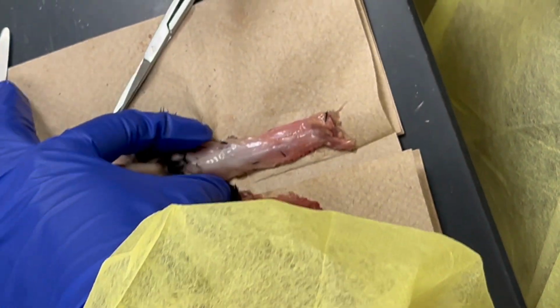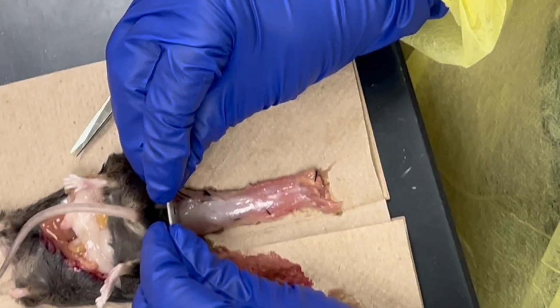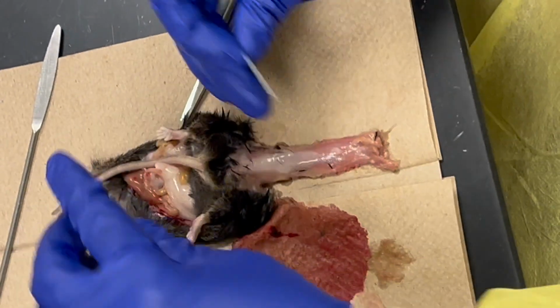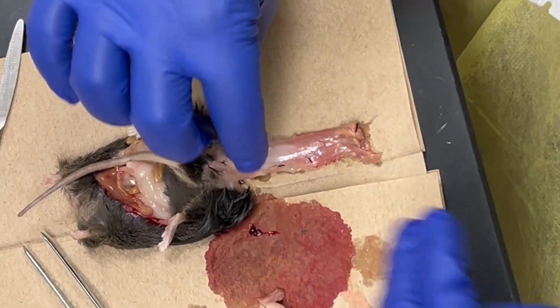Actually, where the lumbar is, where you can feel the hip bone, I will cut there. Do you cut after the right hip there? Okay. Because sometimes I need to cut a little more. If I feel it, I put it in.